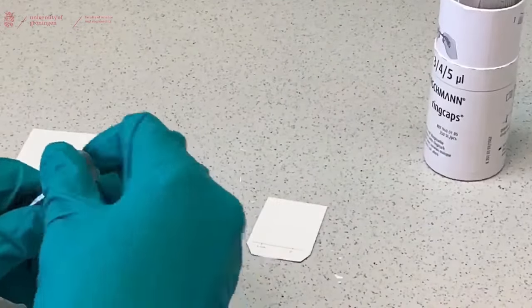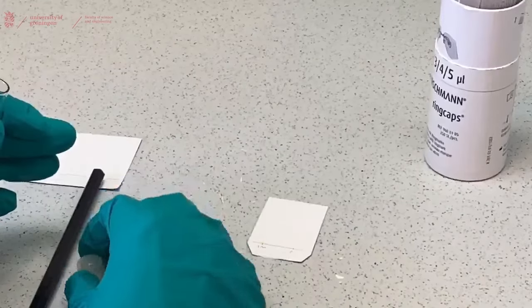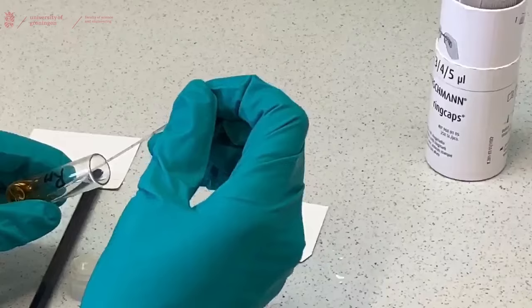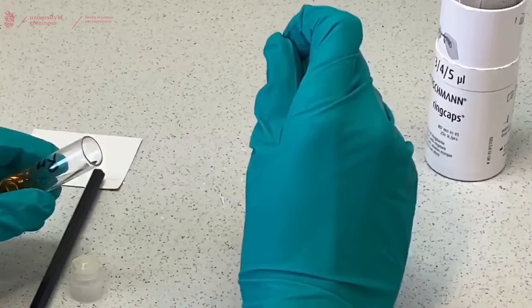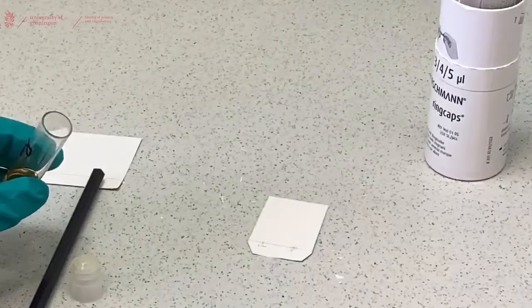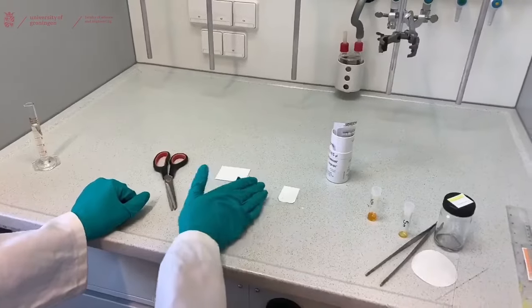Clean your capillary or take a new clean capillary which is often easier. And place the reaction mixture on the other spot that you want to make. So this is the solid phase of our TLC.